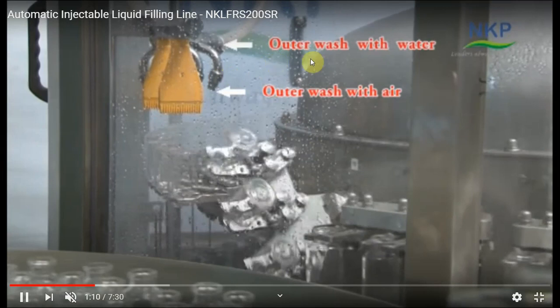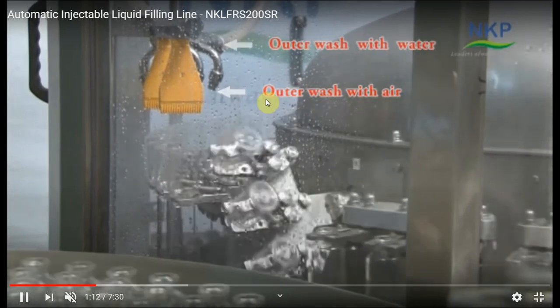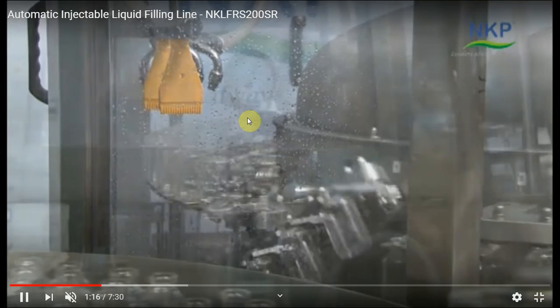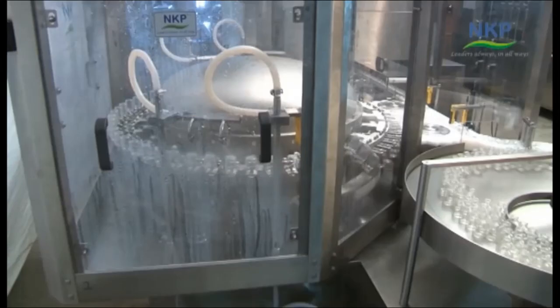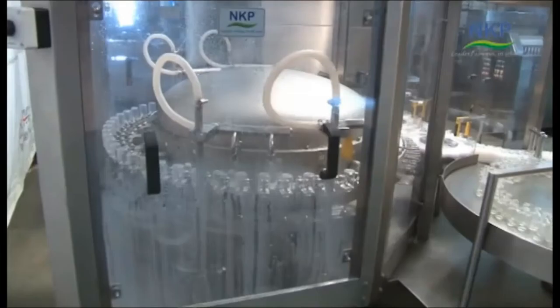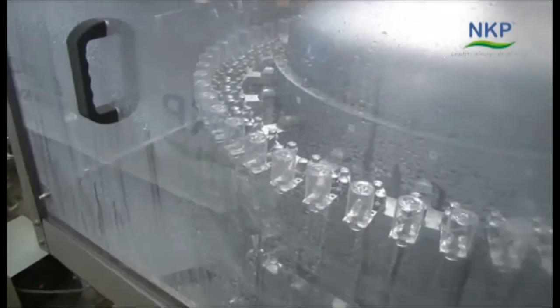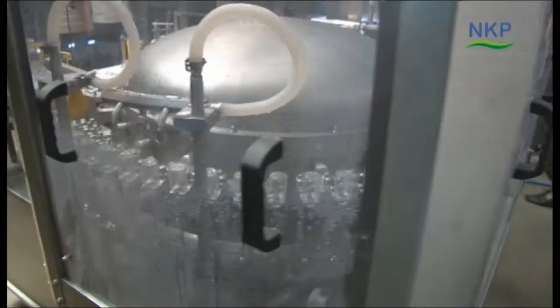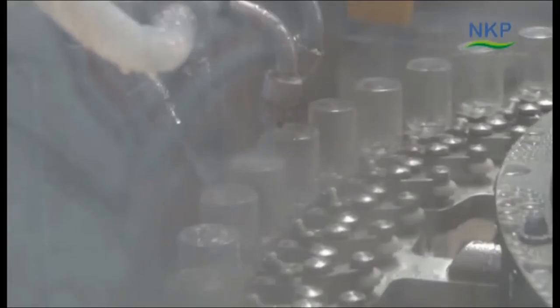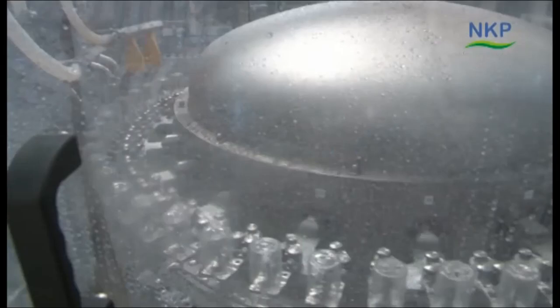And this area is outer wash with water. You can see at the label that outer wash with water and outer wash with air. The outer of the vials is washed with the water and air in that particular area, through which it is passed. You can see the movement of the vials in this particular machine. And this is the wash of air and washing of the water, the outer of the vials.